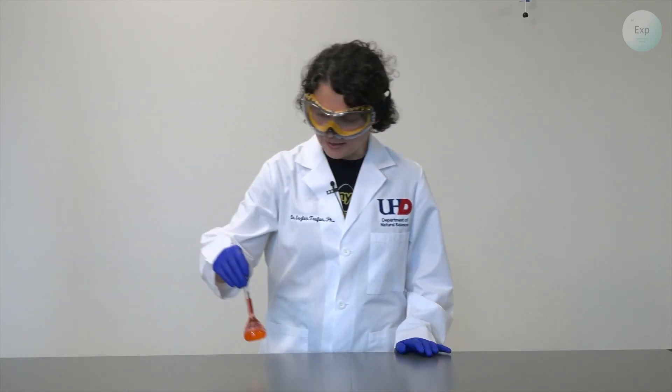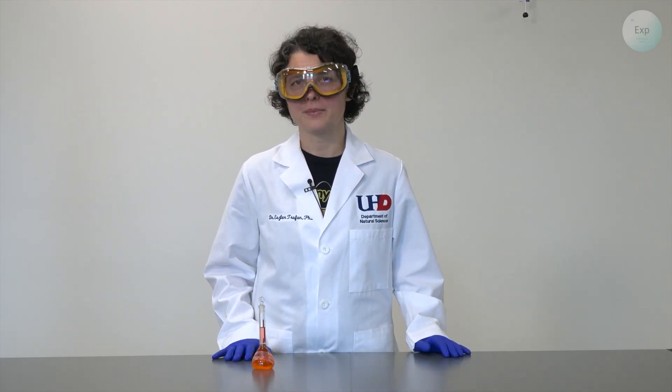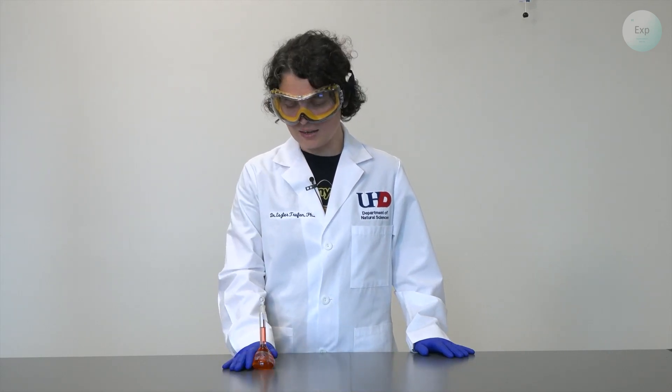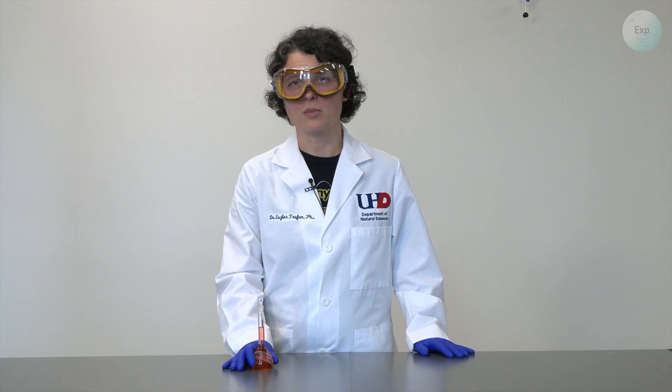I'm going to demonstrate how to dilute a stock juice solution. I originally prepared a juice solution by diluting the concentrate available commercially approximately fourfold. I know the exact volume of the original solution that I used, and I also know the final volume of my solution.